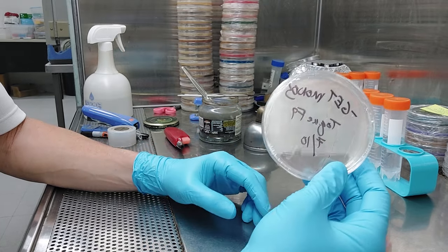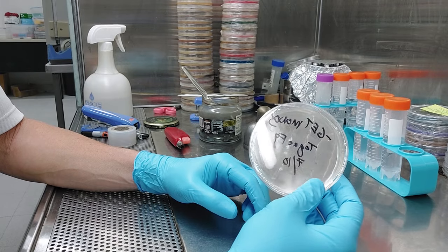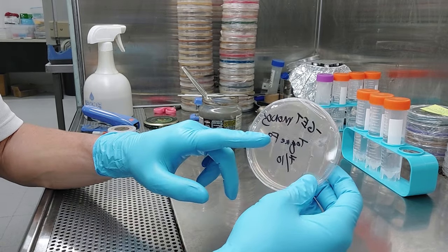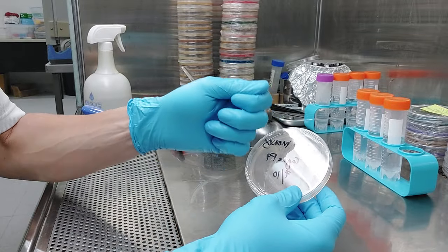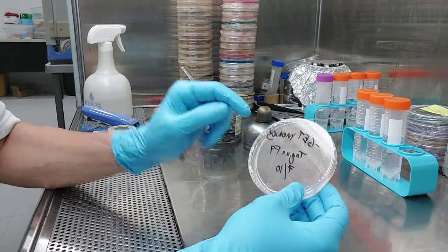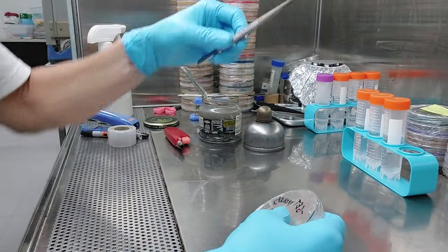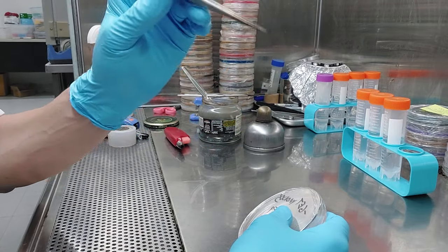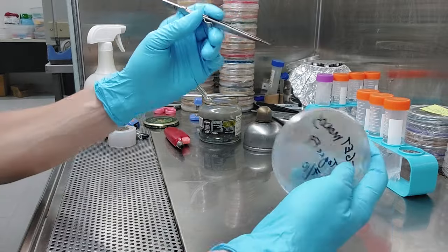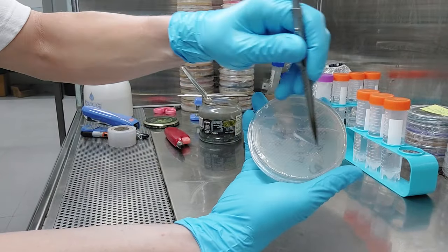What I did was the grab-and-drag on this plate with a fresh toque swab. I grew the toque, it was F8, so now it's on F9. I basically took the swab and ripped off a little piece of cotton with sterilized tweezers, flame sterilized, and then I just essentially dragged it. You can see here on the back, I just basically took that piece of cotton and dragged it in here.